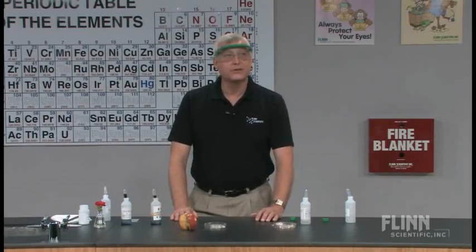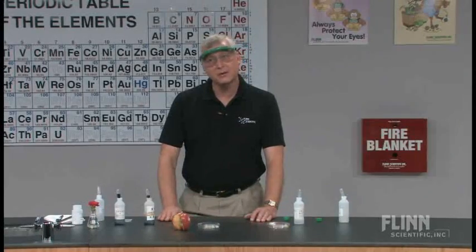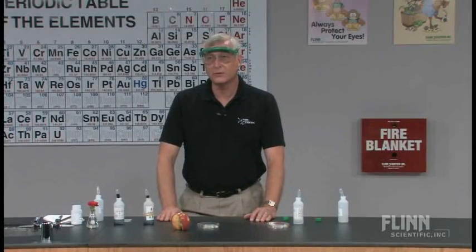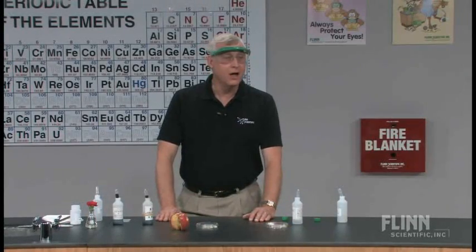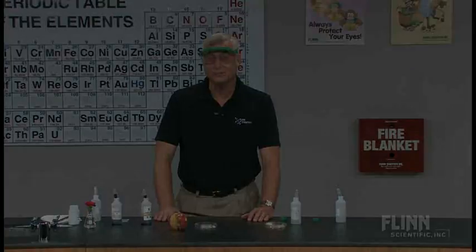So this is the Small Scale Acid Rain Lab — a quick and easy way to show some of the effects that acid rain might have on some common environmental materials.